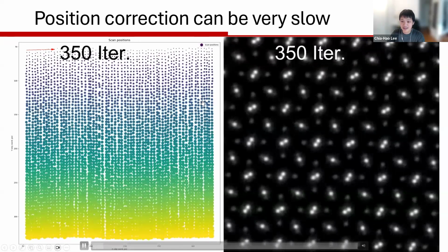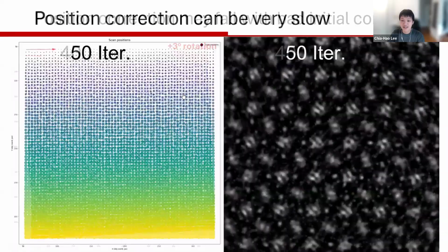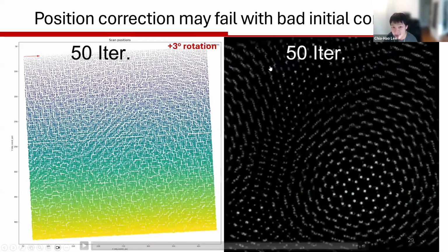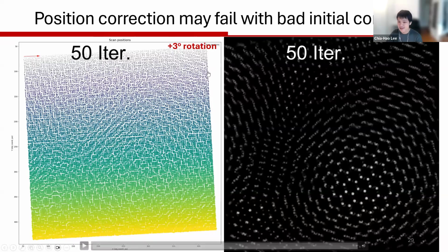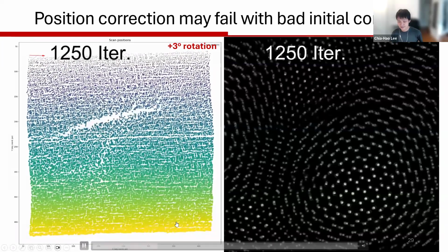But beyond that, here's an example of the twisted bilayer dataset where I intentionally put in a 3-degree rotation incorrectly. The message here is that your probe position correction can still fail with a bad initial condition. 3 degrees doesn't sound like too much. Typically when you align your scan pattern, most engineers do a pretty decent job and can put it around 1 or 2 degrees, so 3 degrees is not too much. But for this specific dataset, I'm going to show you how probe position correction can actually fail.